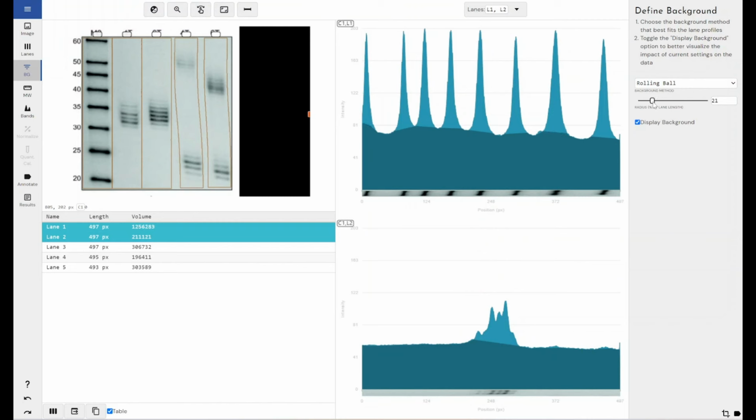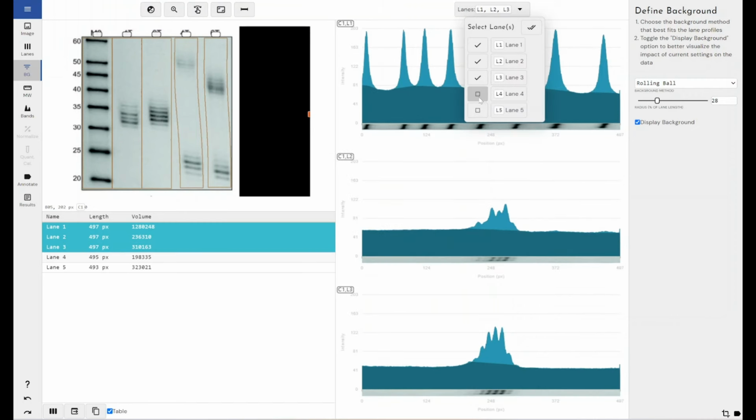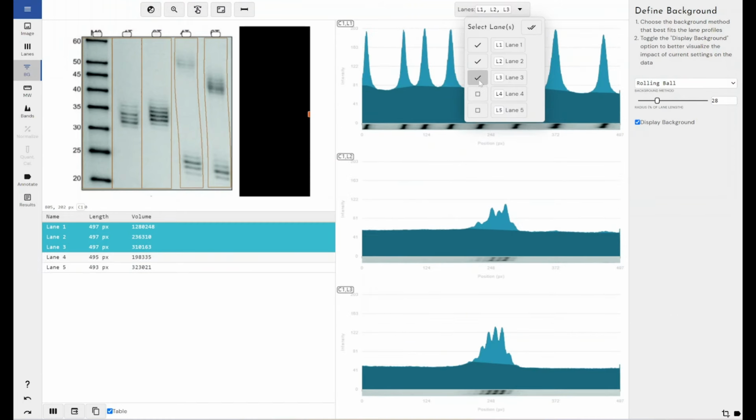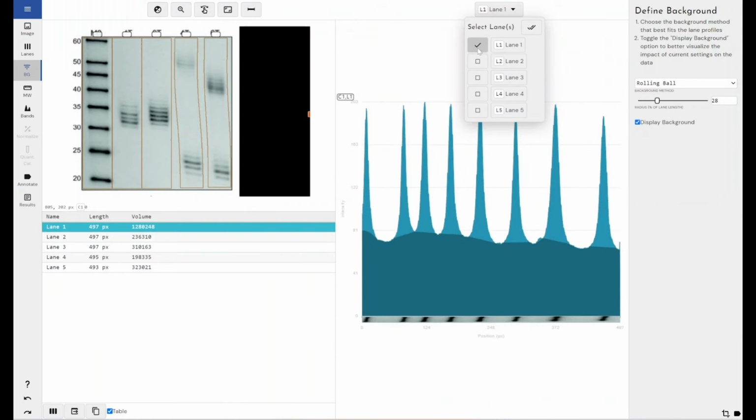So what I just want to do is find a setting that allows me to do that. Yeah, so I'm happy with that. So you can turn all of your lanes on at once to see how it's affecting all of your lanes, or if you just wanted to have one lane on and base your background subtraction just on one lane, you can do that as well. So background subtraction is applied to all lanes equally. However, if I had a multi-channel image, you can change the background subtraction method and intensity per channel.